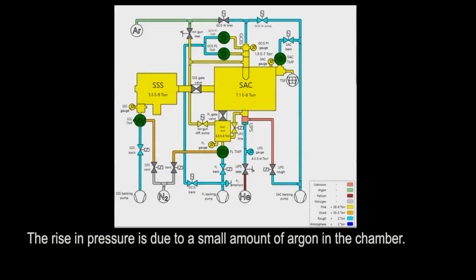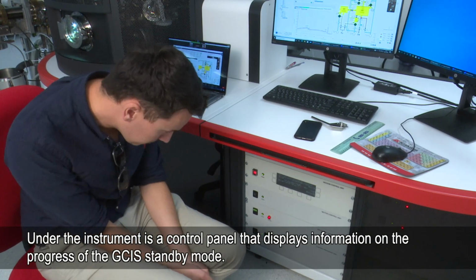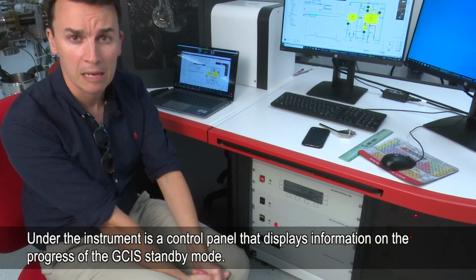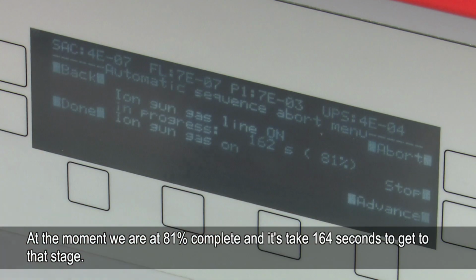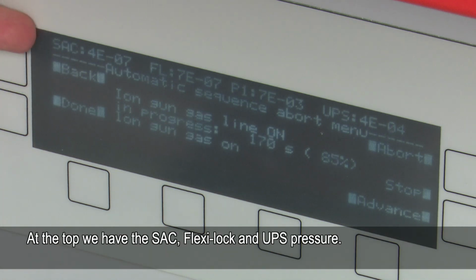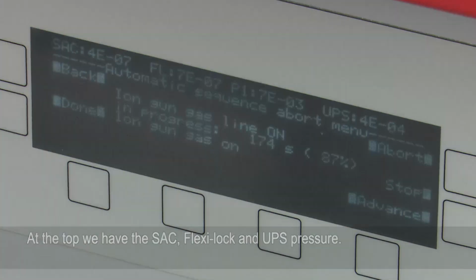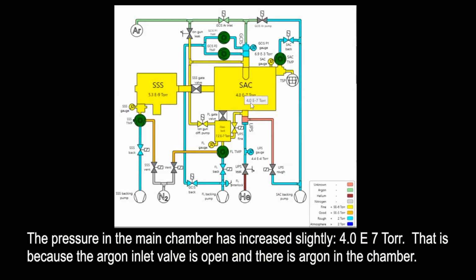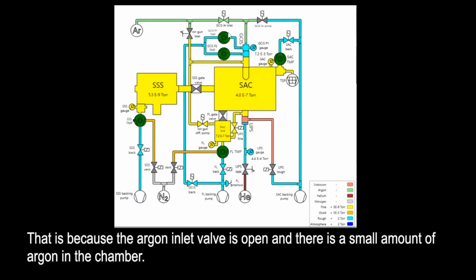While we're waiting for that to happen, under the instrument in the control panel, this gives us the information on the progress of the GCIS standby mode. At the moment, we're at 81% complete, and it's taken 164 seconds to get to that stage. At the top here we've got the sac pressure, the FlexiLock pressure, and the UPS pressure as well. Now you can see that the pressure in the main chamber has increased slightly to 10 to the minus 7 torr. That's because the argon inlet valve is open, so there's a small amount of argon in the chamber.